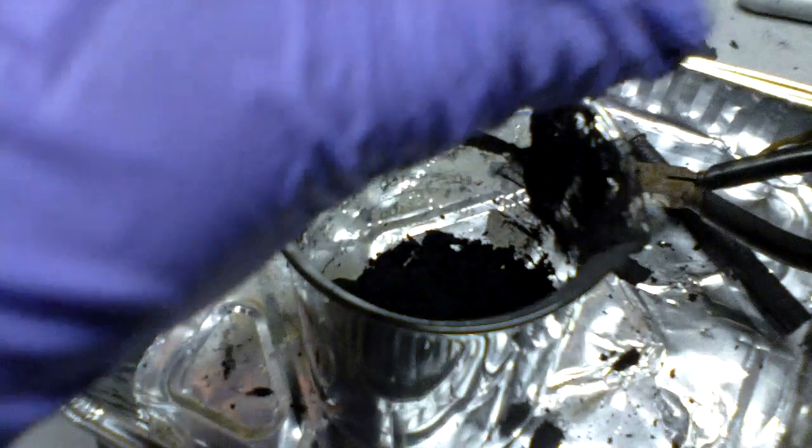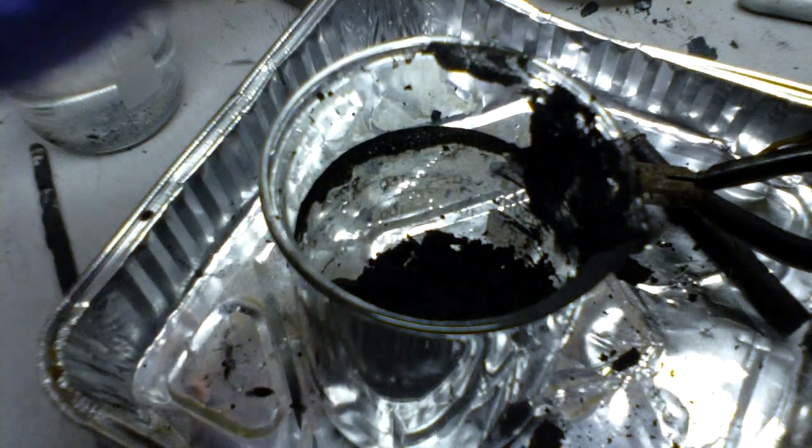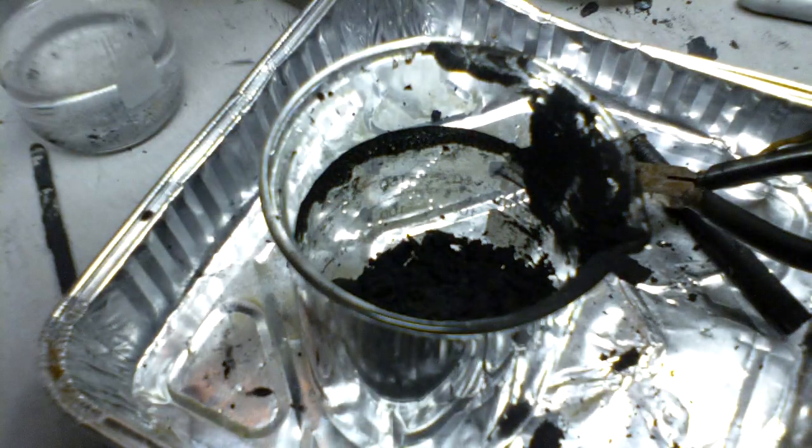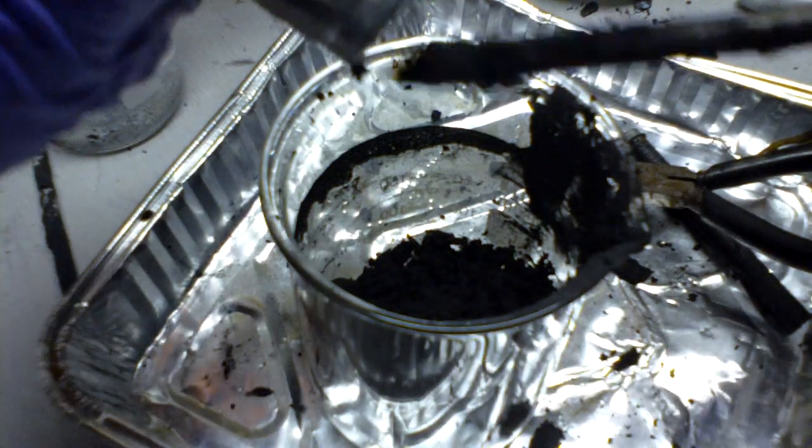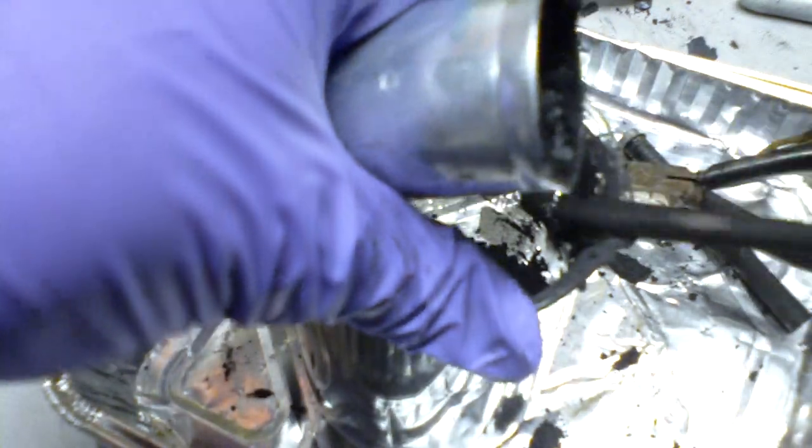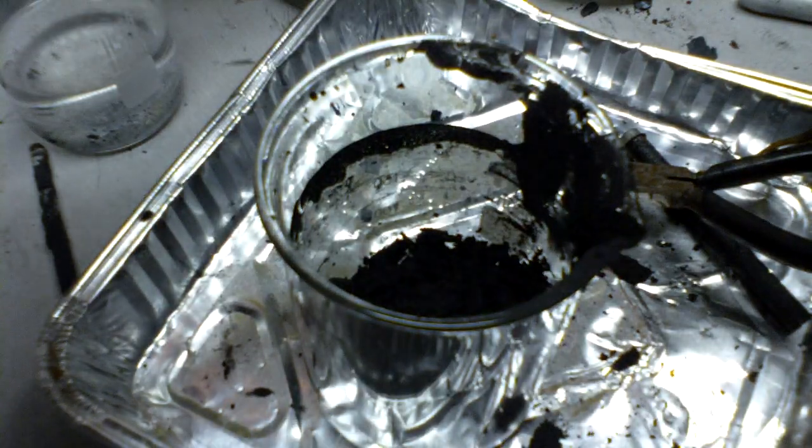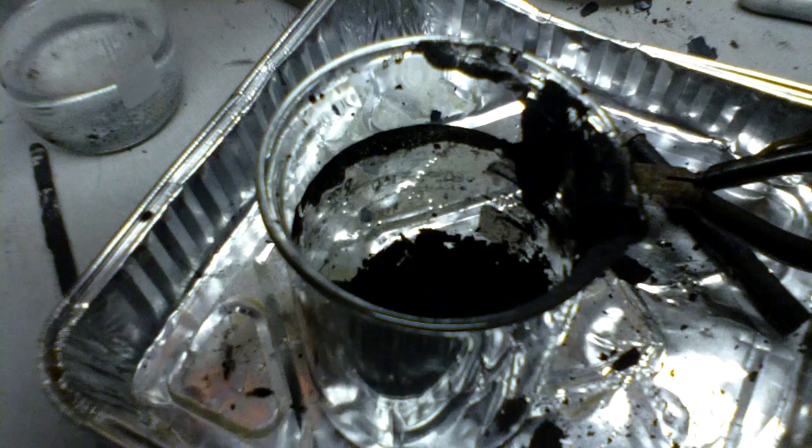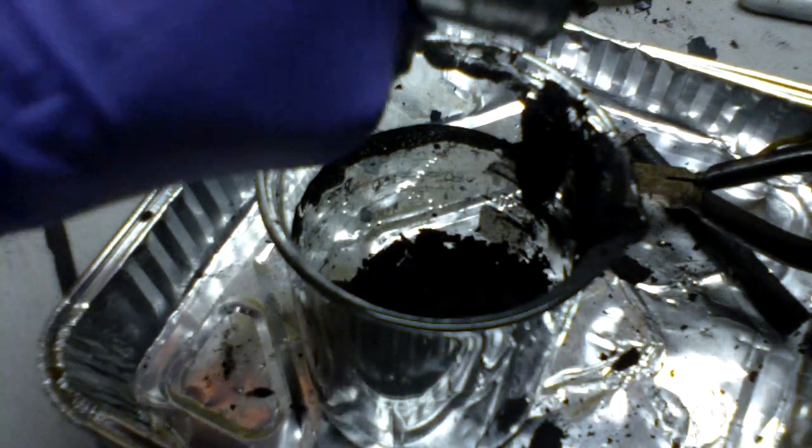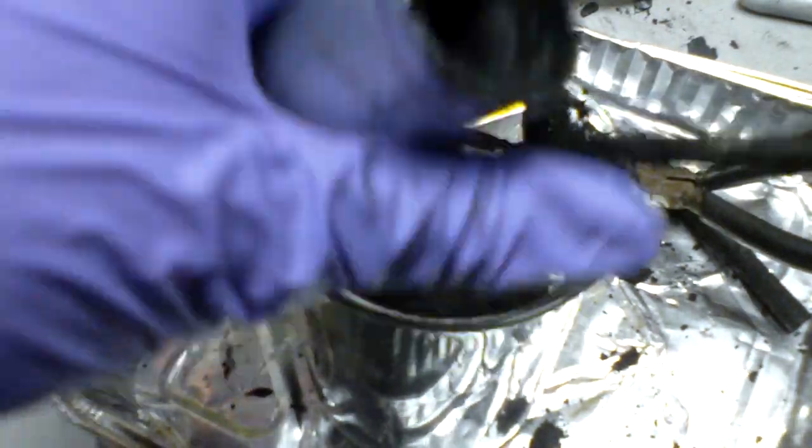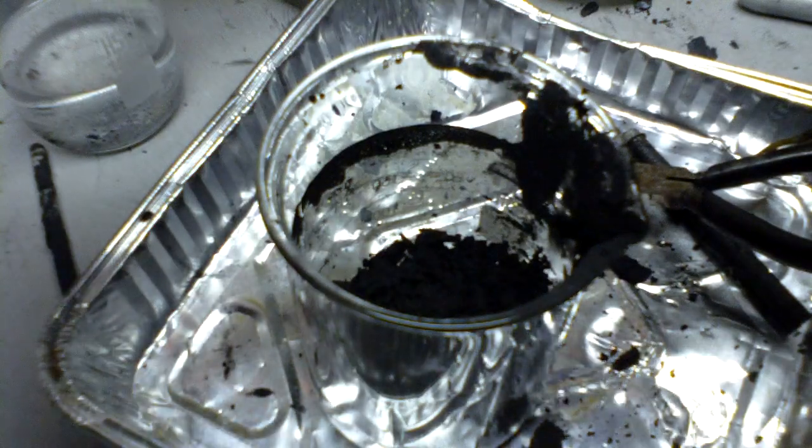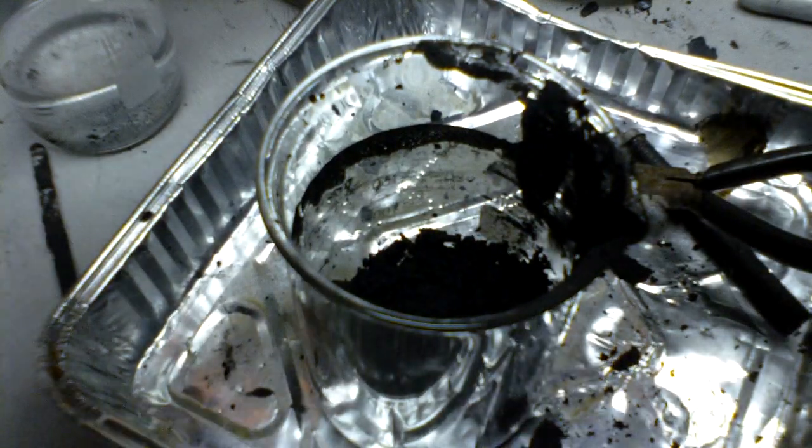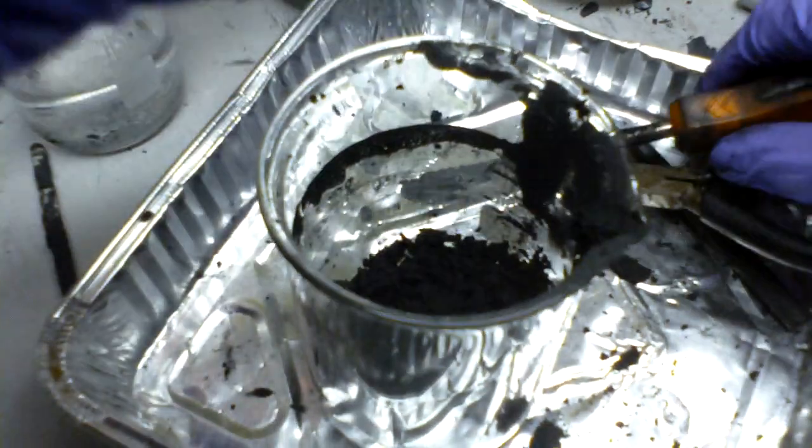Now that's all the chemicals that's inside of it. Now it's just an empty zinc canister. Save the metal. Just use a pair of scissors and cut it down the side so that it opens up. And then it's a useful zinc sheet. You can melt it, react it with HCl, or other reactions.